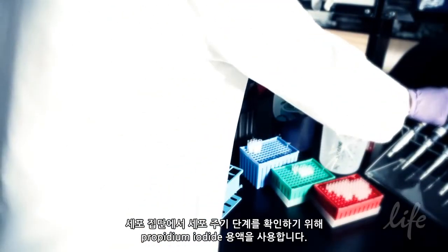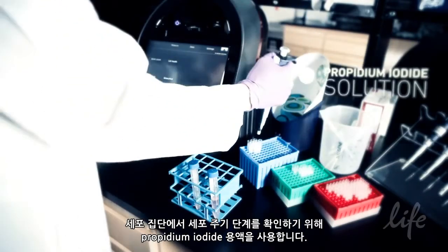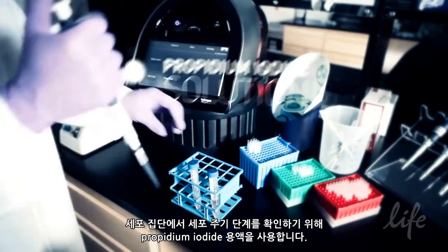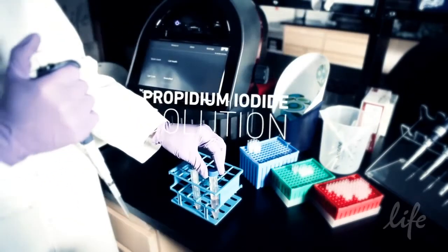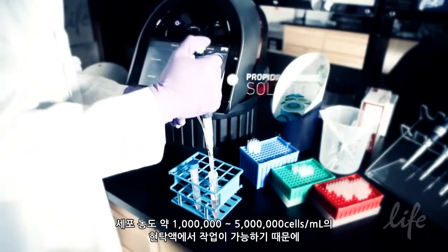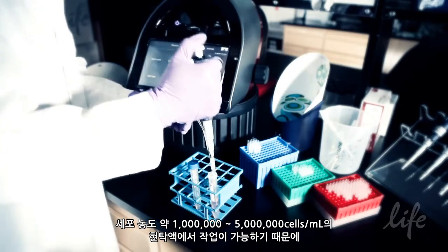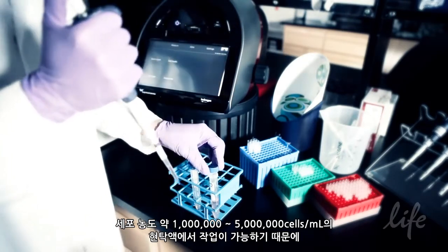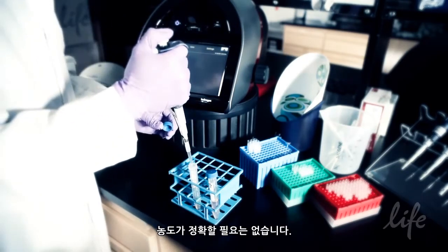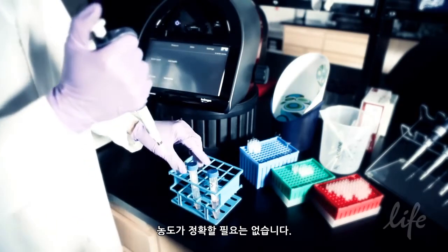The propidium iodide solution is used to identify stages of the cell cycle in a population. This assay works well on cell suspensions containing from about 1 million to about 5 million cells per milliliter, so the concentration doesn't need to be exact.